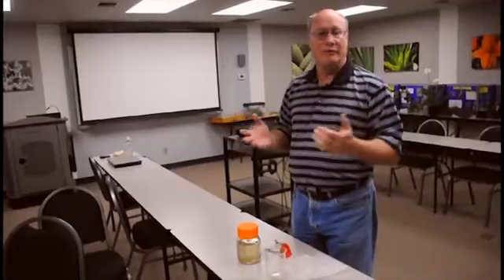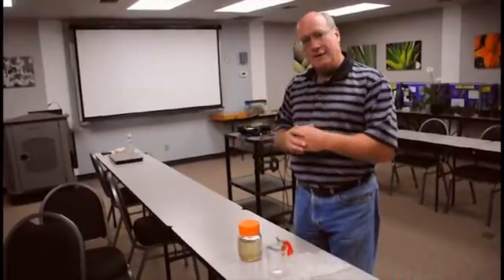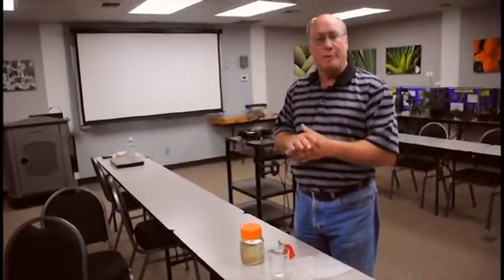And then you can filter the solution and take that filtered screen and put it under the microscope and actually count the number of pests or see if they're alive, dead or whatever. So it's a good way to monitor for thrips specifically.